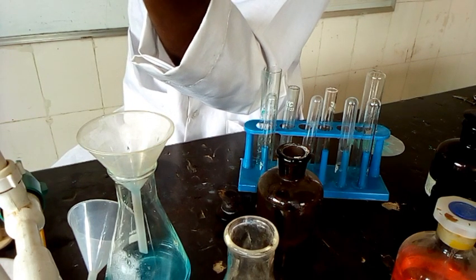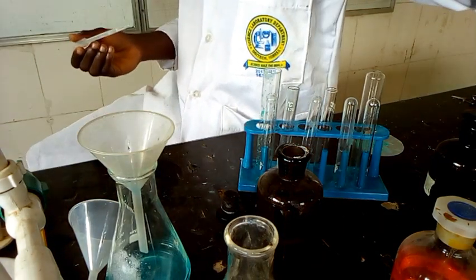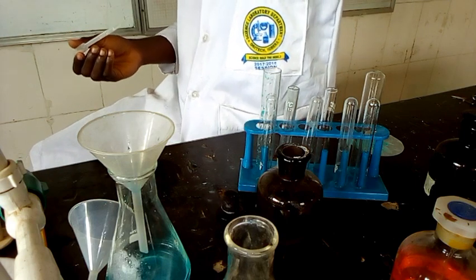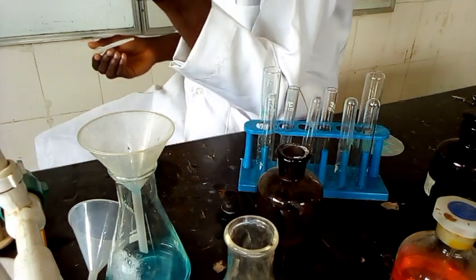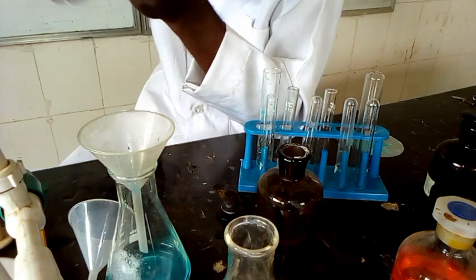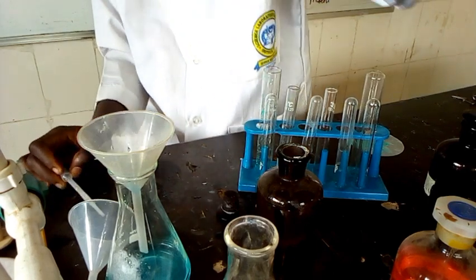This means the blue gelatinous precipitate persists on addition of NaOH to the initial mixture of residue and HCl. So this blue PPT formed persists. That means we are suspecting copper. In this sense, copper is suspected.